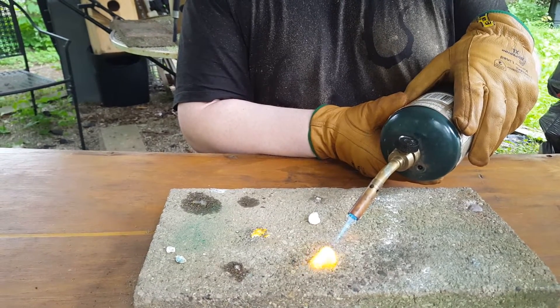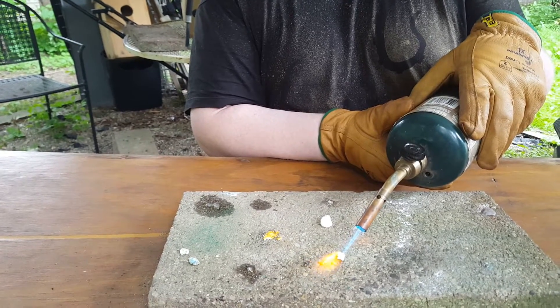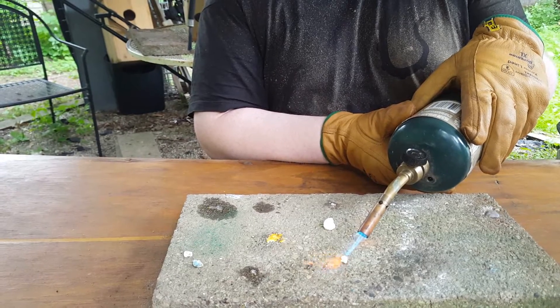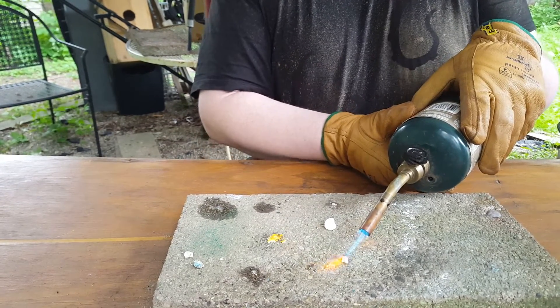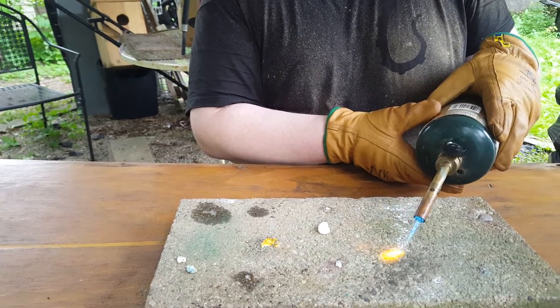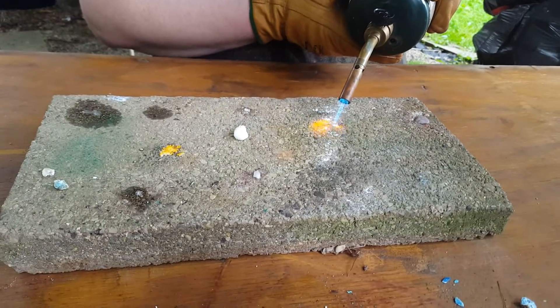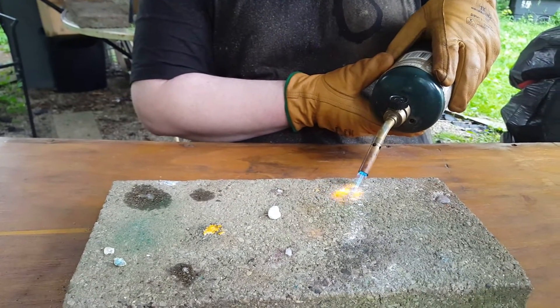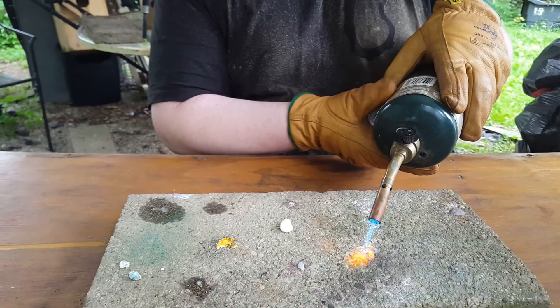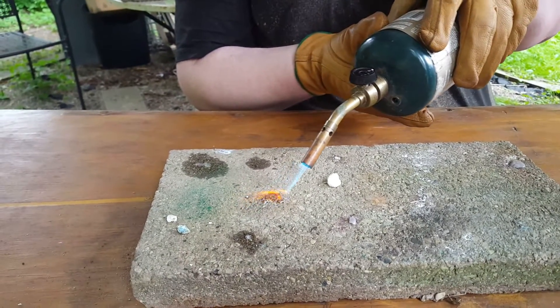This one has a darker orange color — that is the calcium. And this one is a little bit brighter; I'm also using it to clean off this brick. This one is the sodium. They're actually very similar. This one is also sodium as well.